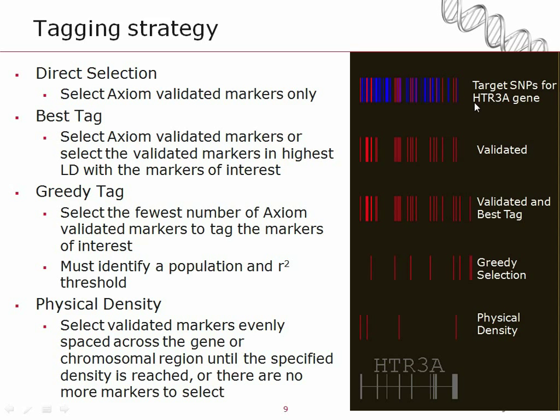On the right side of the slide here, you can see for a single gene, HTR3A, displayed on the top are all the target markers in that gene, color coded blue if they're taggable and red if they're validated. And you can see the effects of the different selection methods as you move down for selecting the markers from within those regions. Starting at the validated, where you get all the red ones, validated plus best tag, or the greedy selection, and then by the physical density at the bottom.